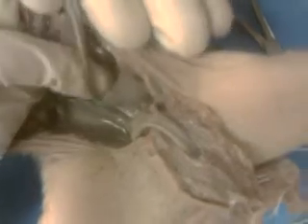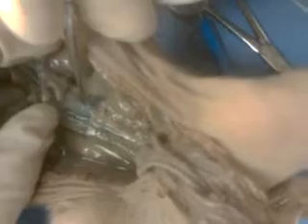It's not very big, but that little pink vessel right there, that would be the left renal artery, okay? So there's the artery, there's the vein, and there, of course, obviously the kidney. And then this kind of collapsed muscular tube, that's the ureter that goes off of the bladder, which is right here, between the two umbilical arteries, left and right.